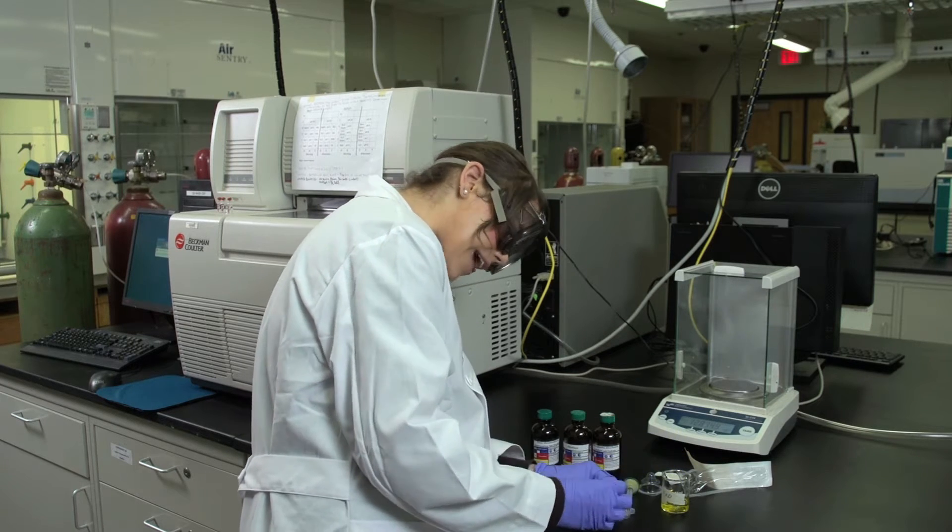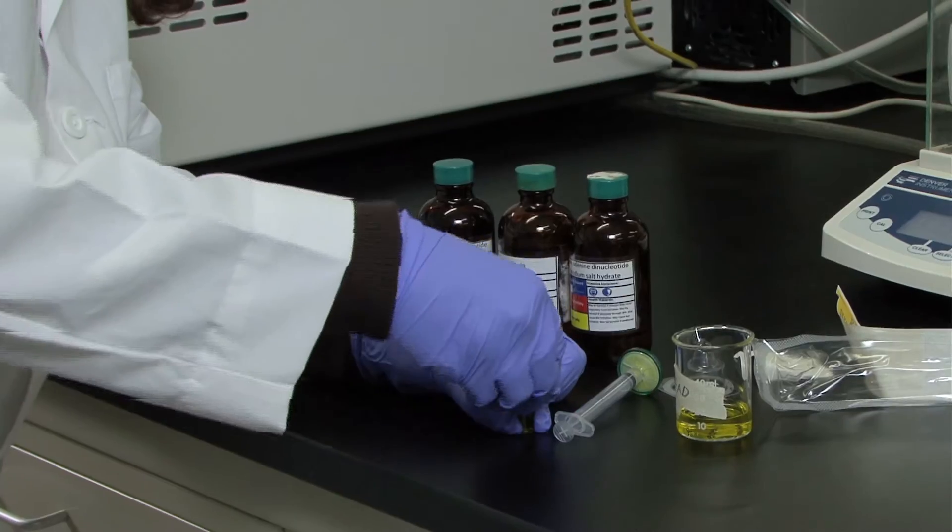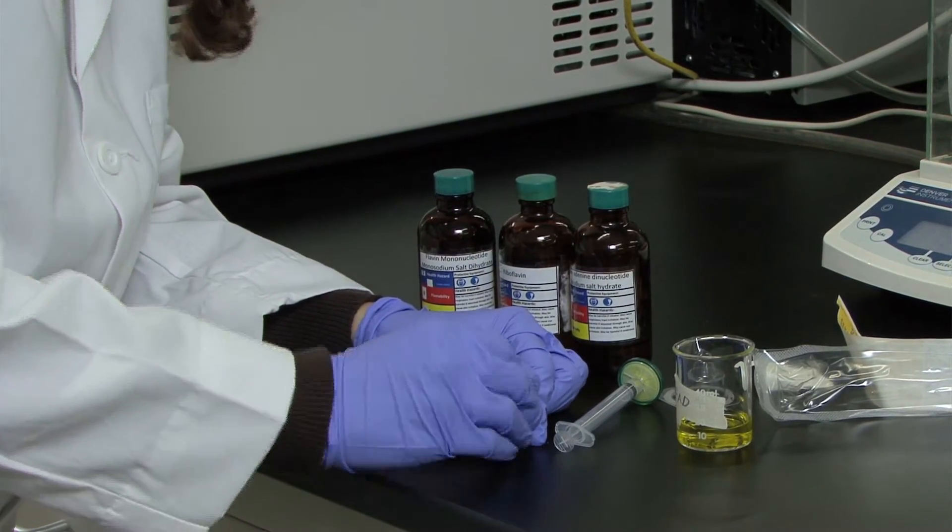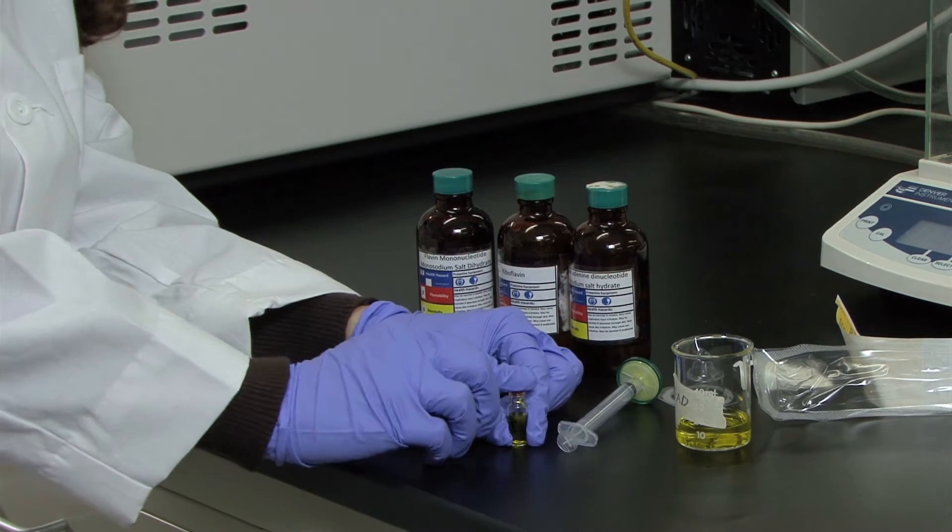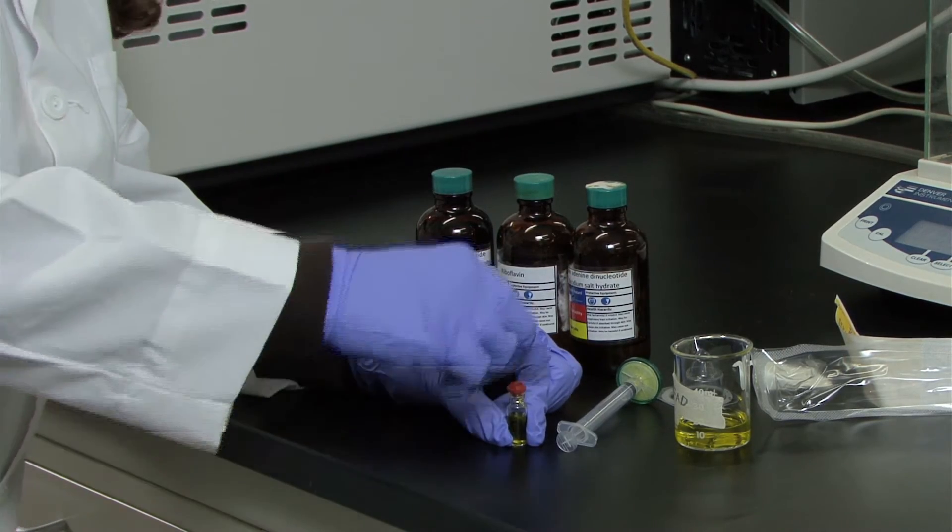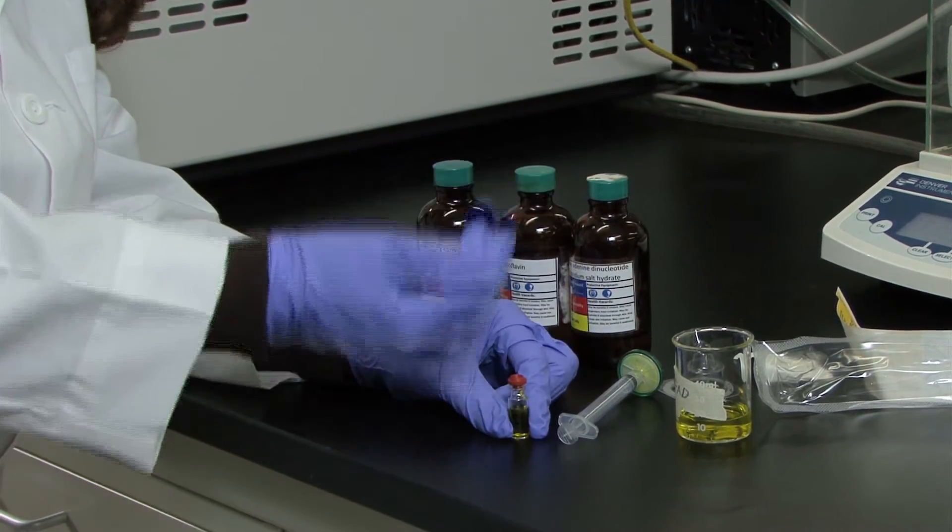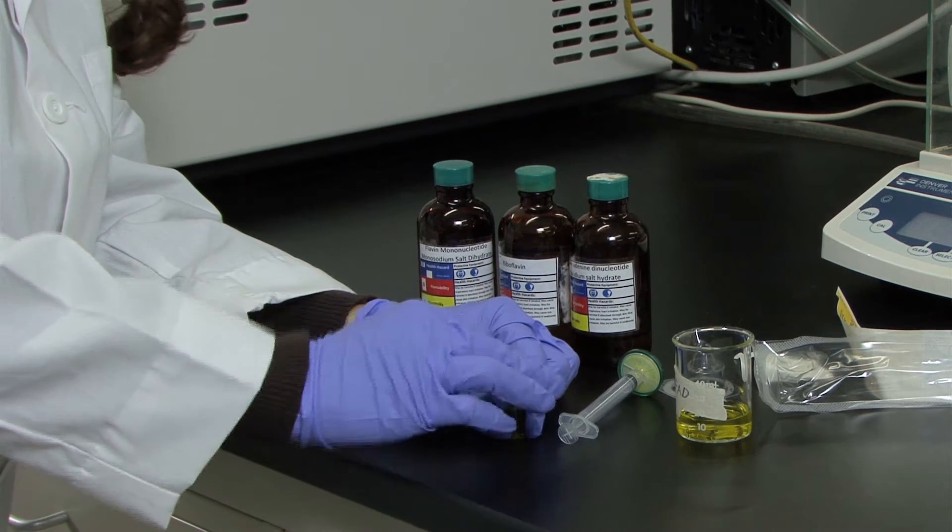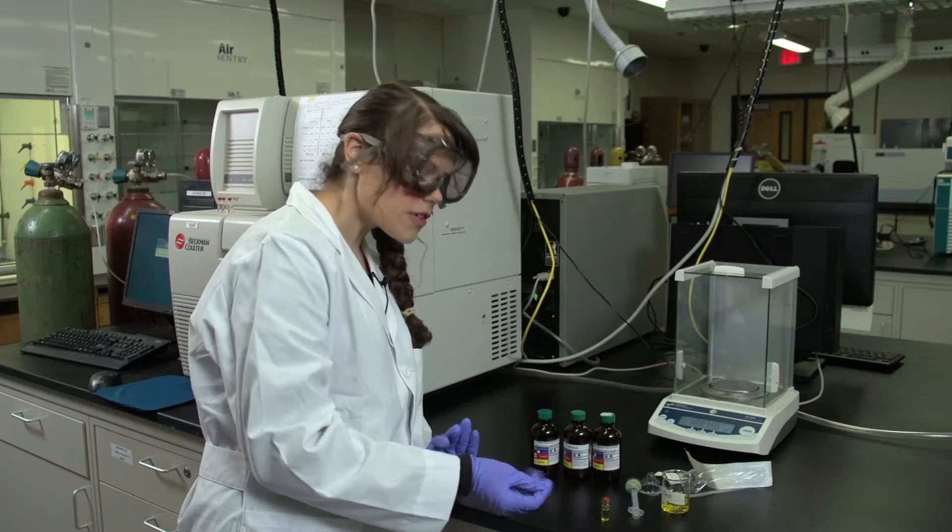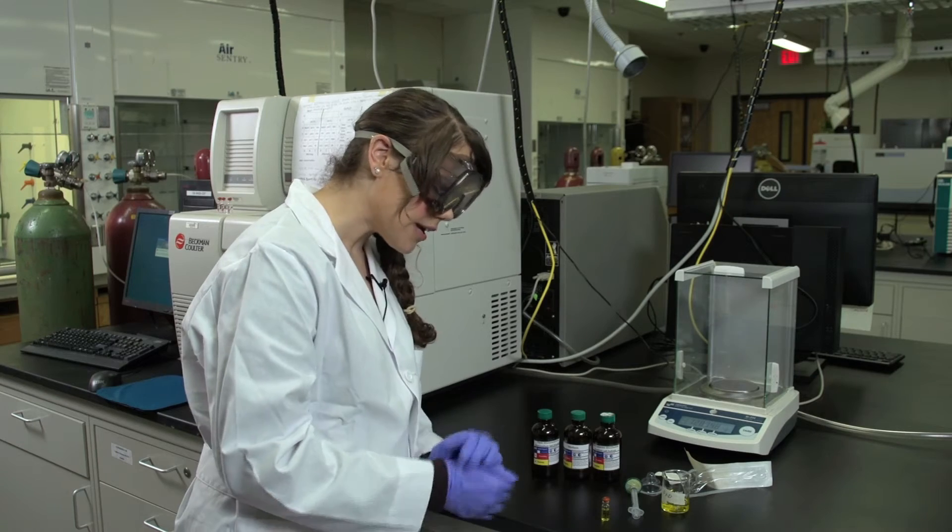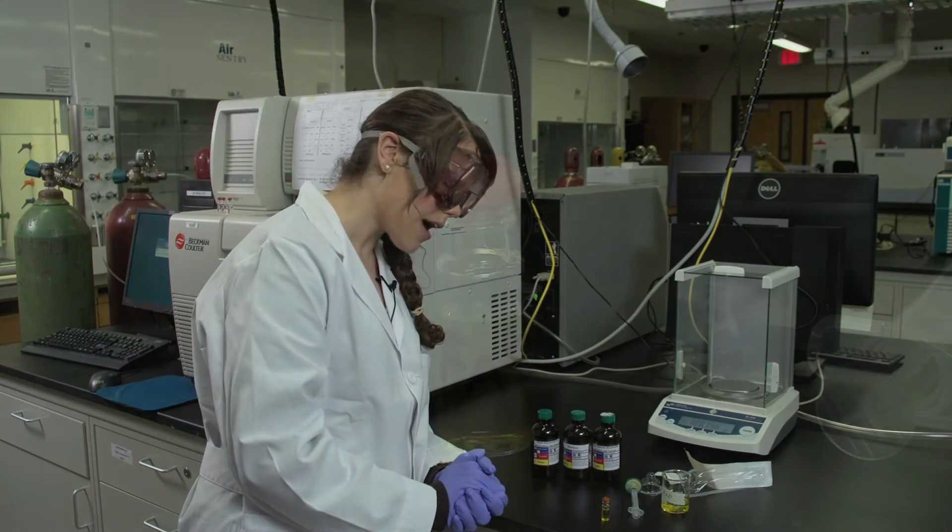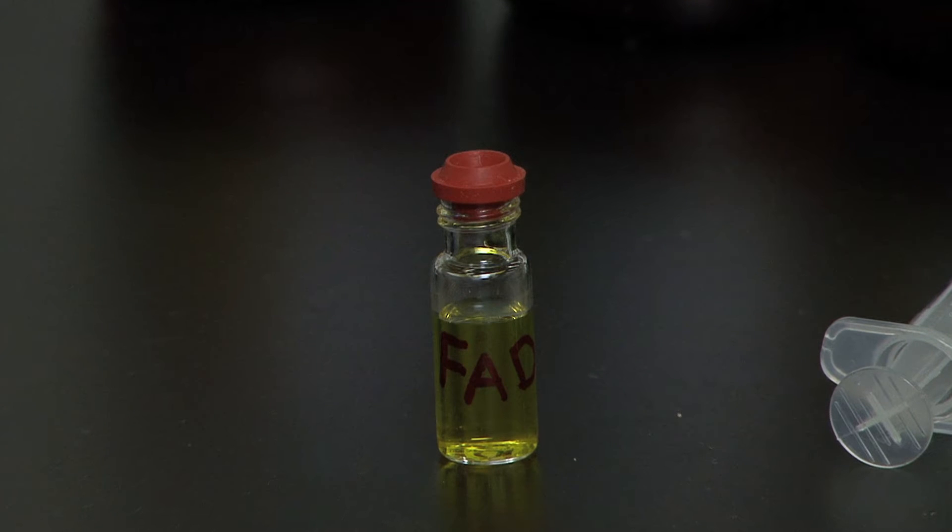To put on the cap, you just need to press it down. It's very important that when you put the lid onto the vial, that you have it pressed completely down and completely flat. Because when you go to load your vials into the instrument, if the lids are not completely flush, then you have a potential to break the capillary.